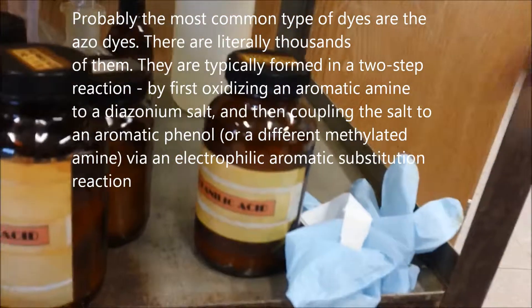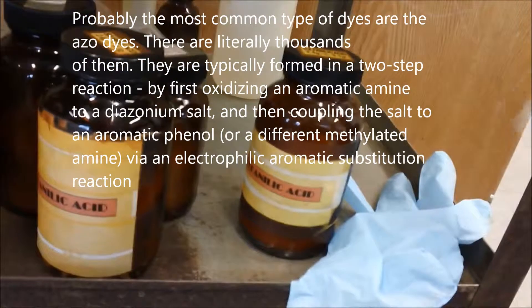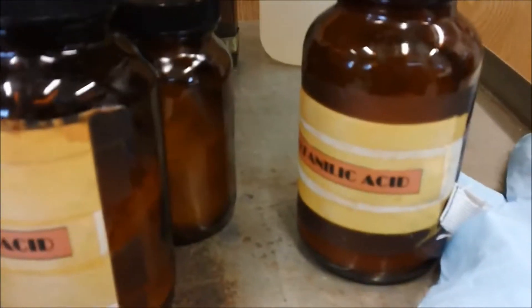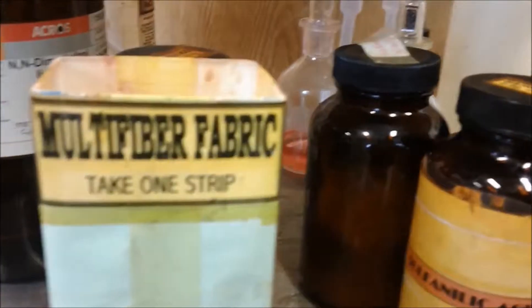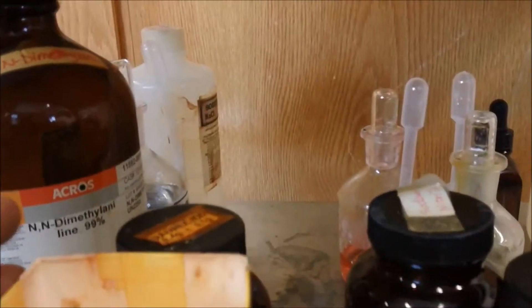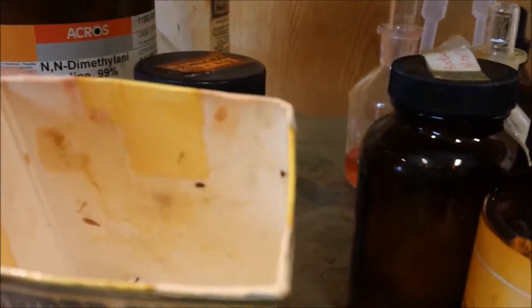They're going to put this in the bath. It has a picture on the book too — it tells you exactly what material it is. The fabric is very special. The different materials, each one — the name of the cotton, and so on — you can find it in the book.